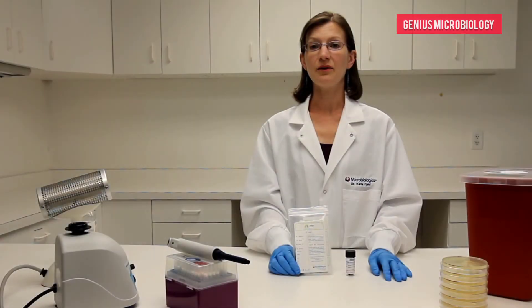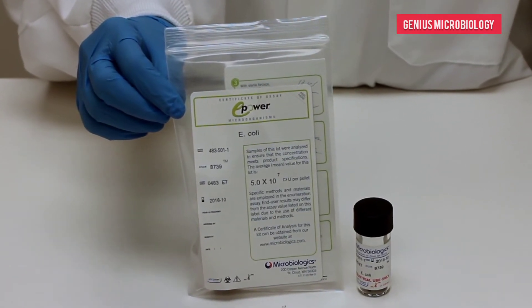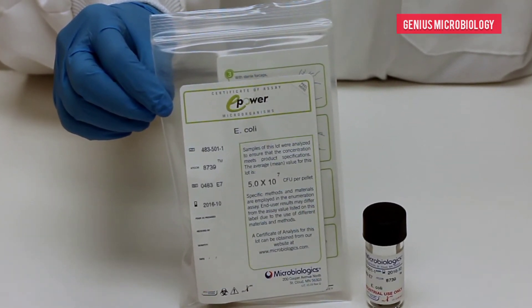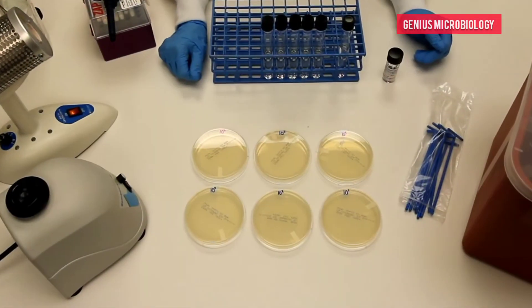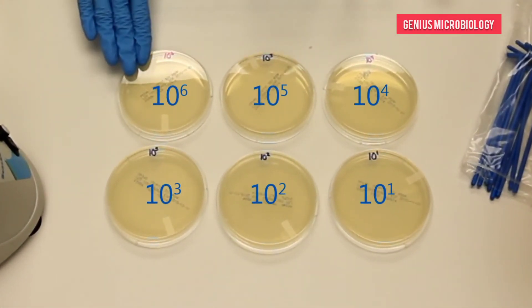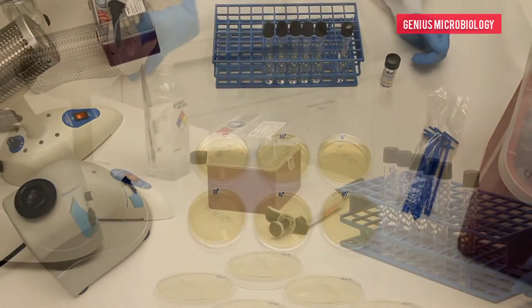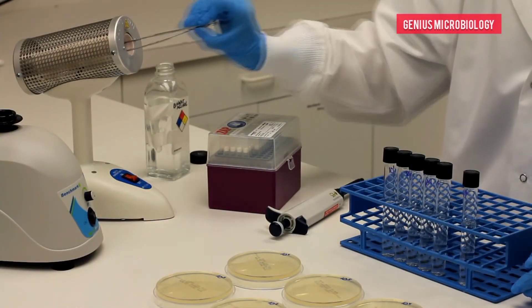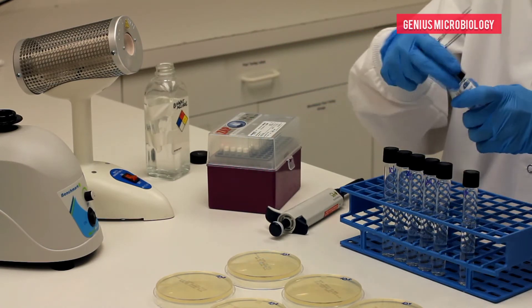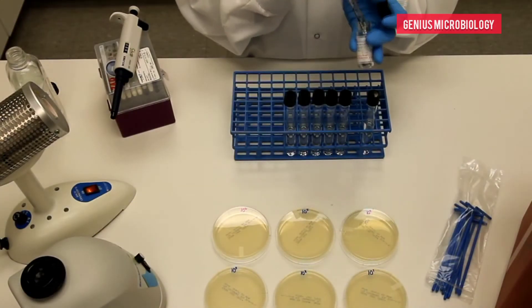And the final dilution would equal 35 CFU per milliliter, our target concentration. Now I will show you how to perform a multiple dilution series with Microbiologics E-Power E7. First, label the plates with the dilution factor. Next, using sterile forceps, place one pellet into 10 milliliters of pre-warmed phosphate buffer.